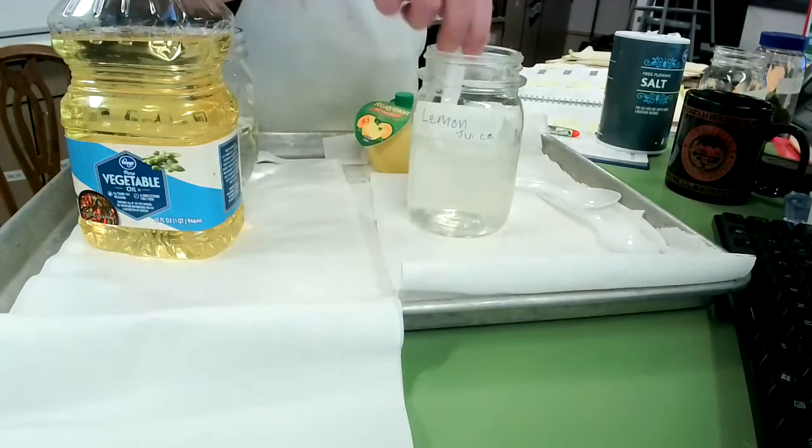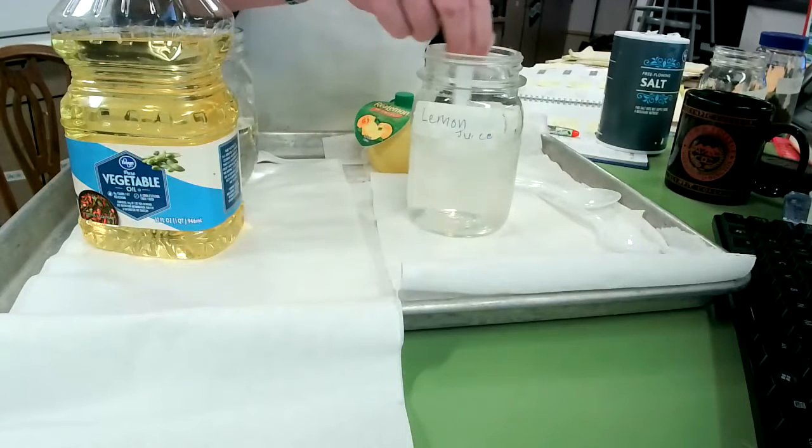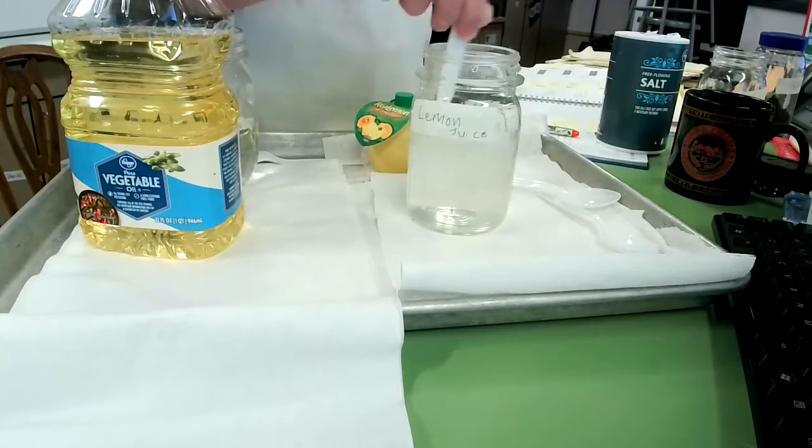Now solutions, if we have a solution, there is a way that you can actually separate the components of solutions, but it usually takes a different process than a simple filtration process. Usually it takes heating up, so you evaporate all the liquid off, all the water off, the solvent, and then you're left with just the solute at the bottom, which is usually some form of a dry powder.